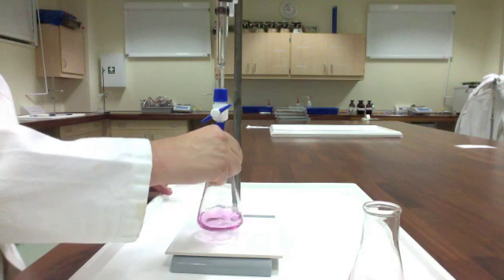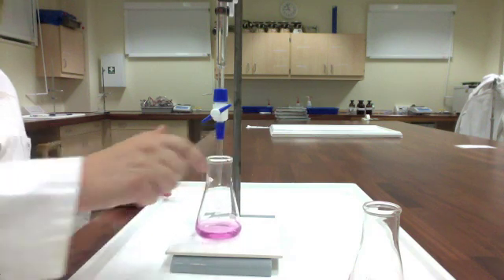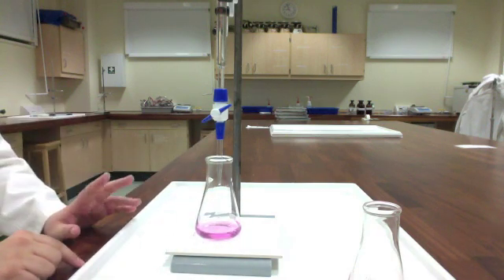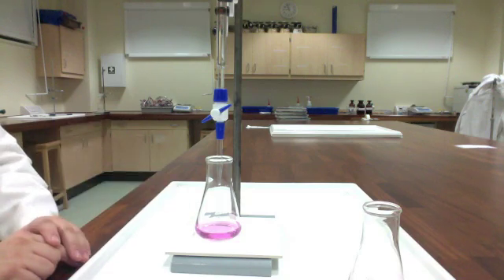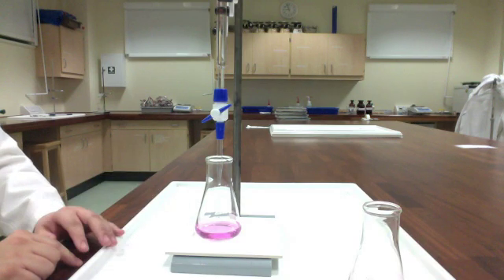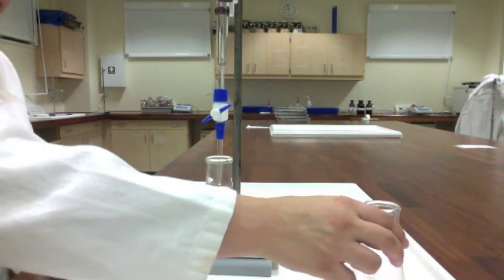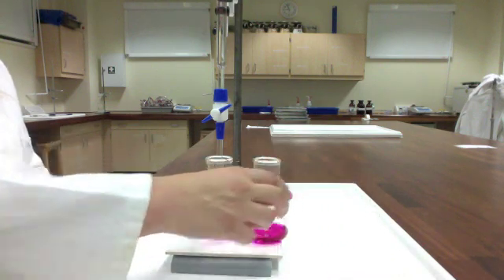So I swirl, swirl, swirled. And I have the faintest pink. And that was the difference of a drop. The drop before, colorless. This drop, pink. So again, I'm going to put these two guys side by side so you can compare.